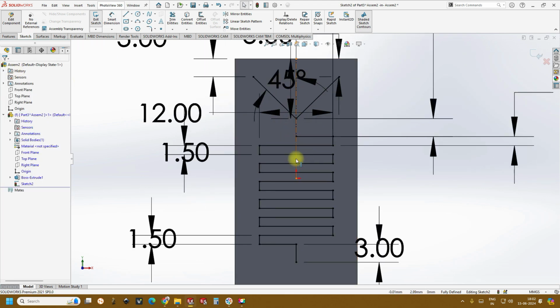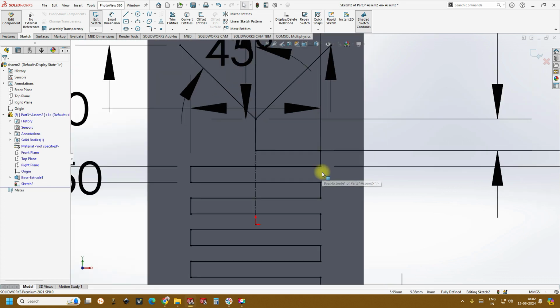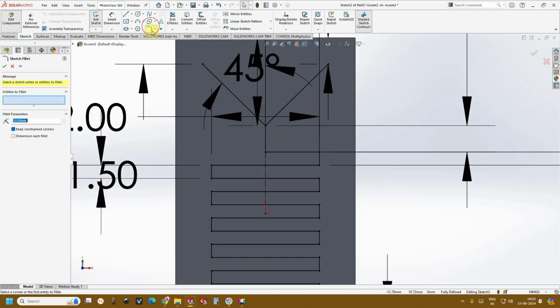And next thing is, now we have created the serpentine, but if you see, these are stress corners, so this needs to be avoided. So go to fillet and click on this junction. It will not take it, but change the fillet diameter. I'll keep my fillet diameter as 0.7 because the distance is 1.5 mm, so I can create a fillet on both sides, both the connections. So for example, I can create it here as well as here. Right, the same way we can do with all.